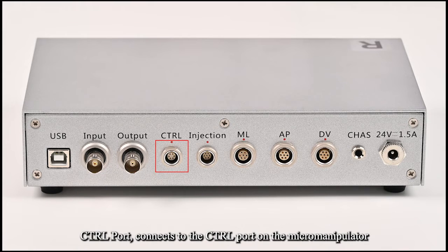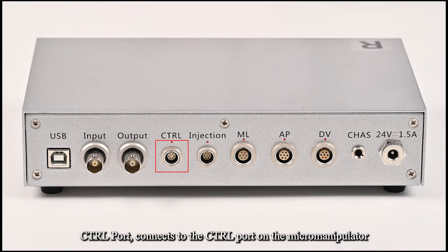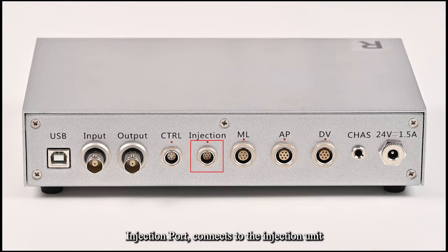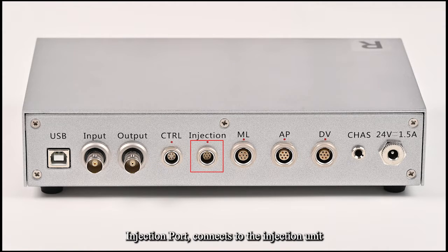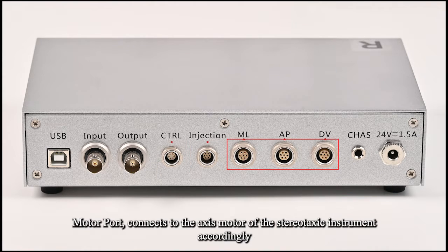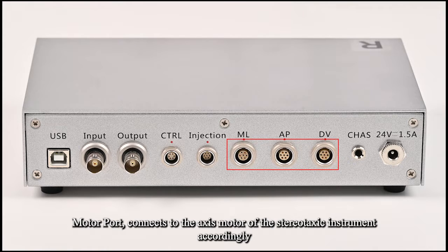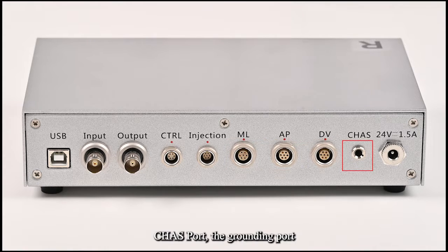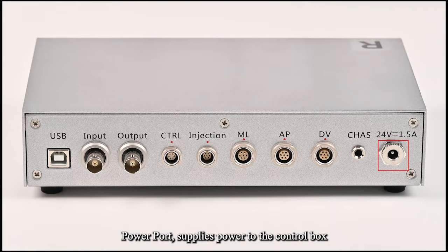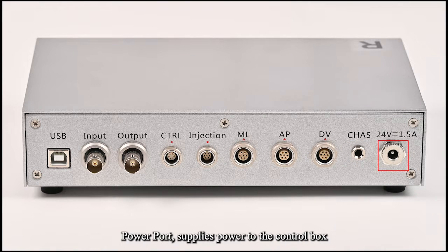The control port connects to the control port on the micromanipulator. The injection port connects to the injection unit. The motor port connects to the axis motor of the stereotaxic instrument accordingly. The chassis port is the grounding port. The power port supplies power to the control box.